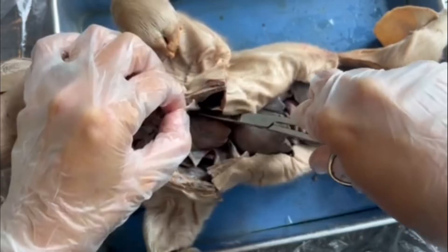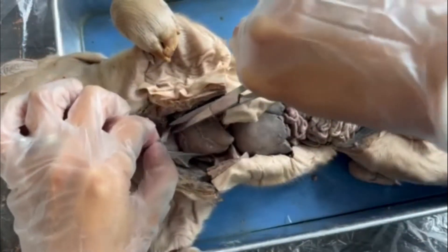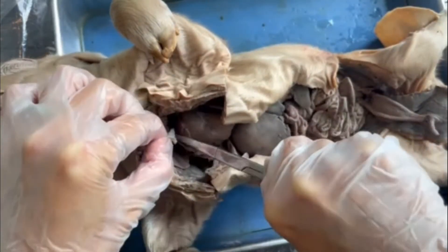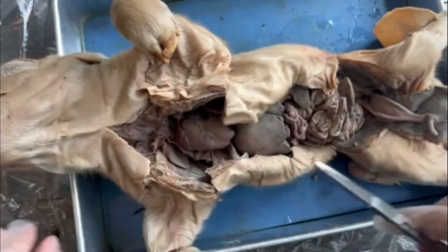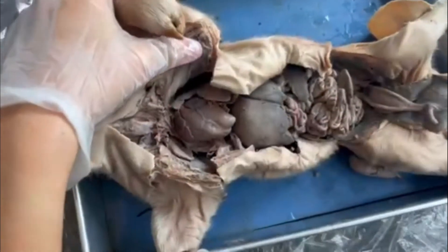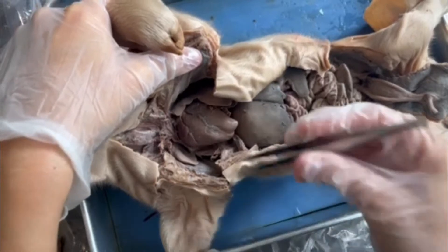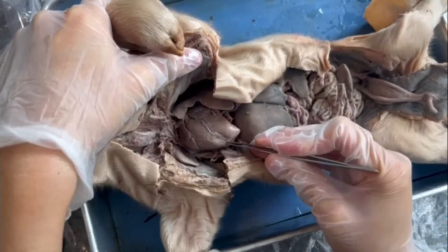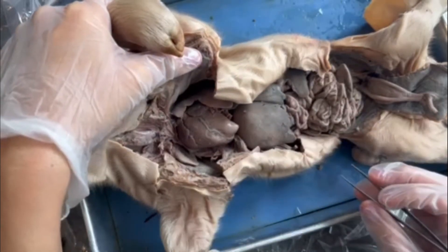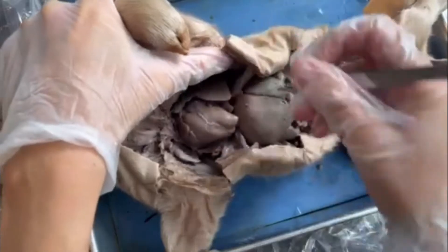The pericardium is almost like a trash bag in consistency. Running across the heart, you are able to see the coronary artery. This is the artery that delivers oxygenated blood to the heart itself so that the heart muscle has oxygen to produce ATP.